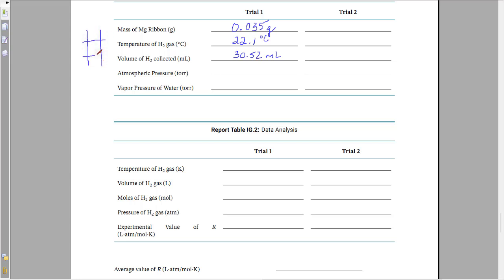Now, you want to be careful with the eudiometer, because if I draw a little excerpt of it here, it will be numbered sort of backwards. Remember, this tube is upside down in that beaker of water, way down at the bottom. So you want to make sure you're reading it the right way. If I had 30.52, the value would be somewhere in here, full of water like this. So make sure you're reading it correctly as far as reading it up or down.